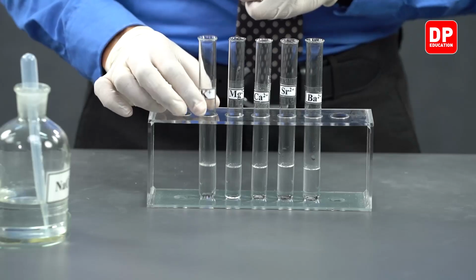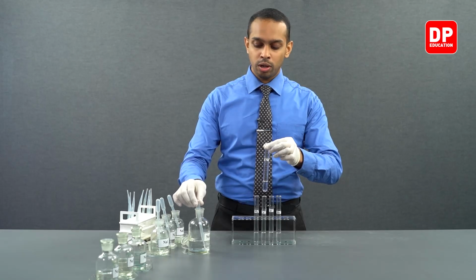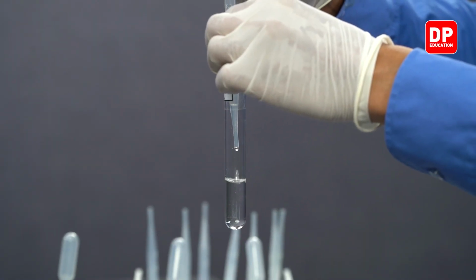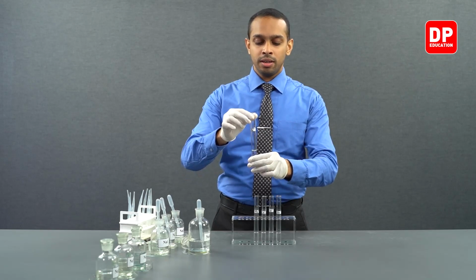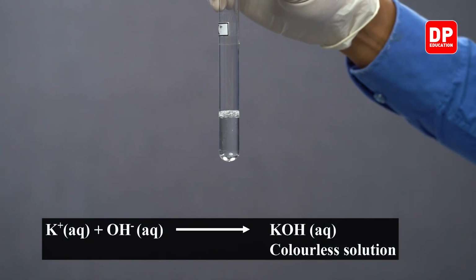To represent the group 1, we have our potassium 1 plus ions. Let's add a small amount of sodium hydroxide and observe if potassium hydroxide that is formed here produces a precipitate. So we have potassium 1 plus ions here along with hydroxide ions in this medium.